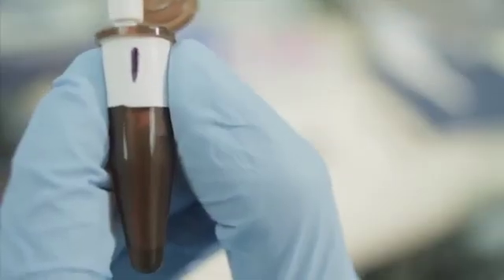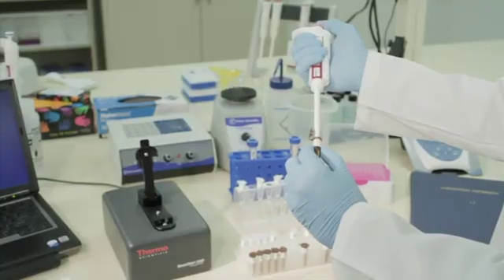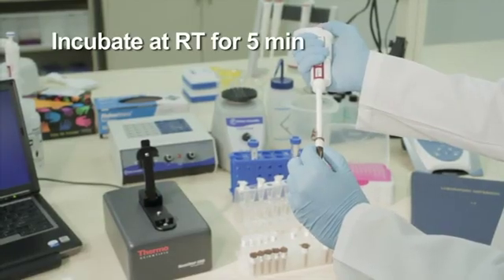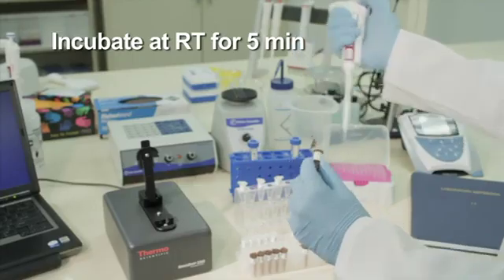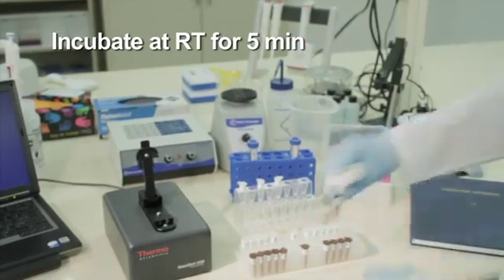Mix the contents of each tube thoroughly by gentle pipetting and allow to incubate at room temperature for 5 minutes. All standards and samples should be equilibrated to the same temperature before measurement, as fluorescence signal is affected by temperature.